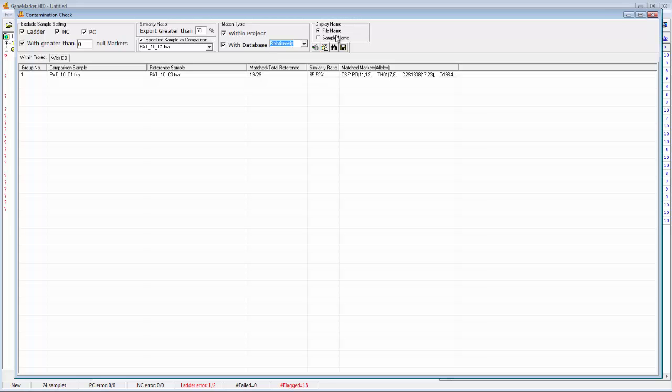And then, of course, over here you can choose if you want to display the file name or the sample name. And then there's some icons down here as well. The most important one that I want to talk about right now is just this little binocular icon. That's just kind of the refresh/search button. So you click that to update the results.